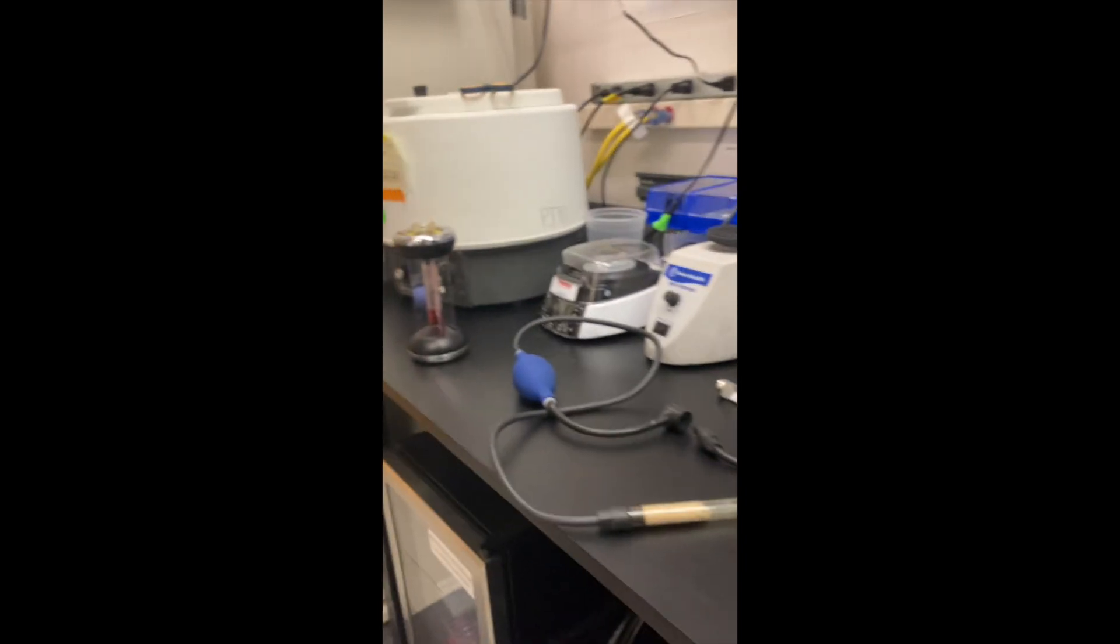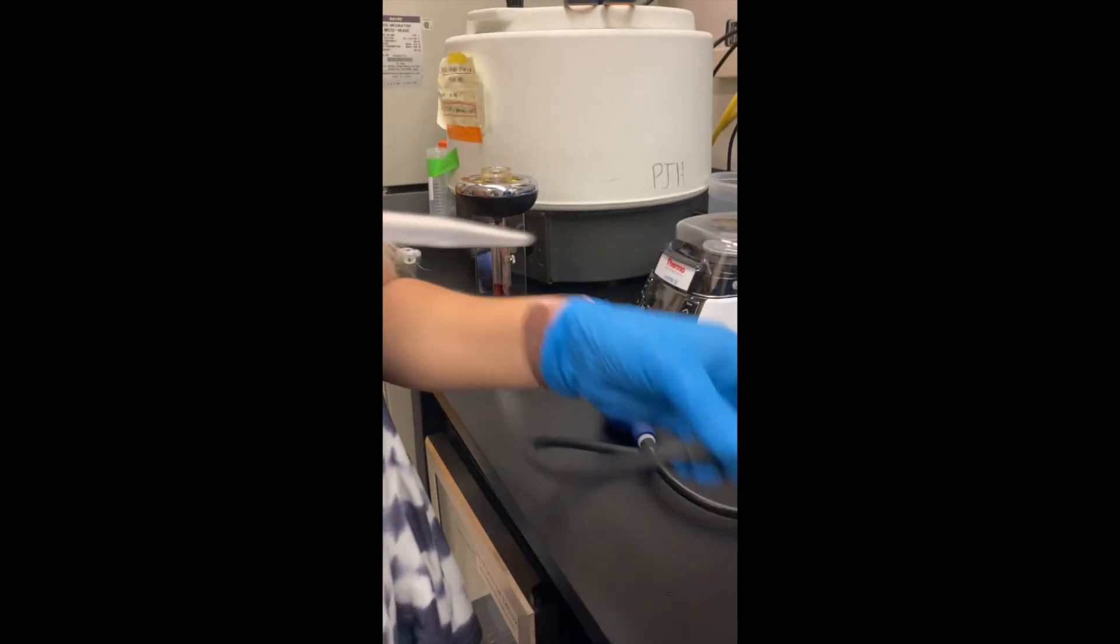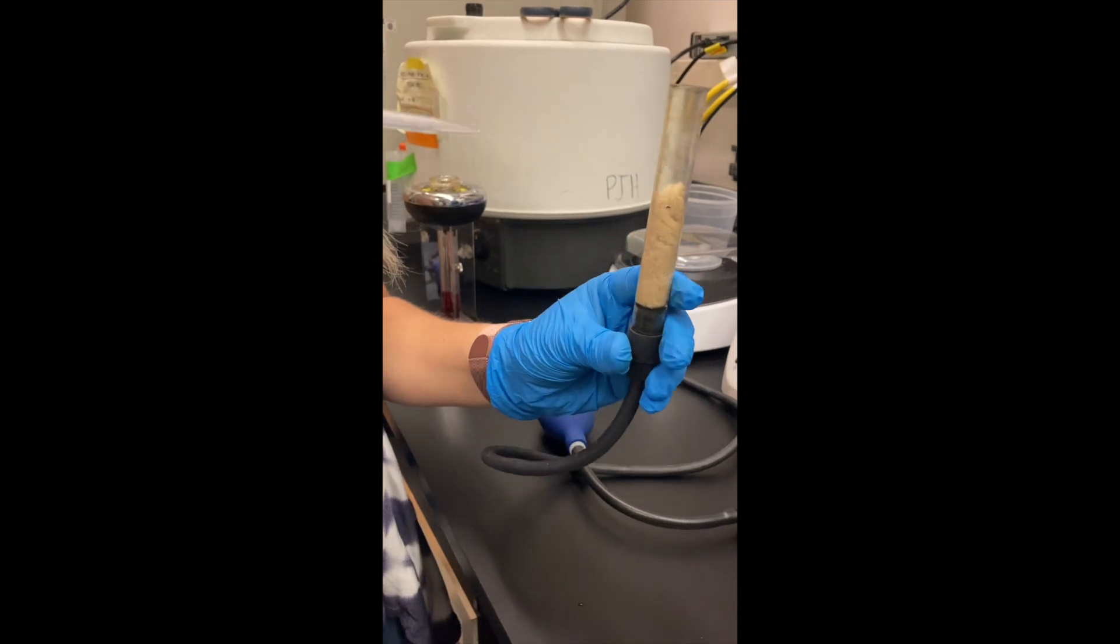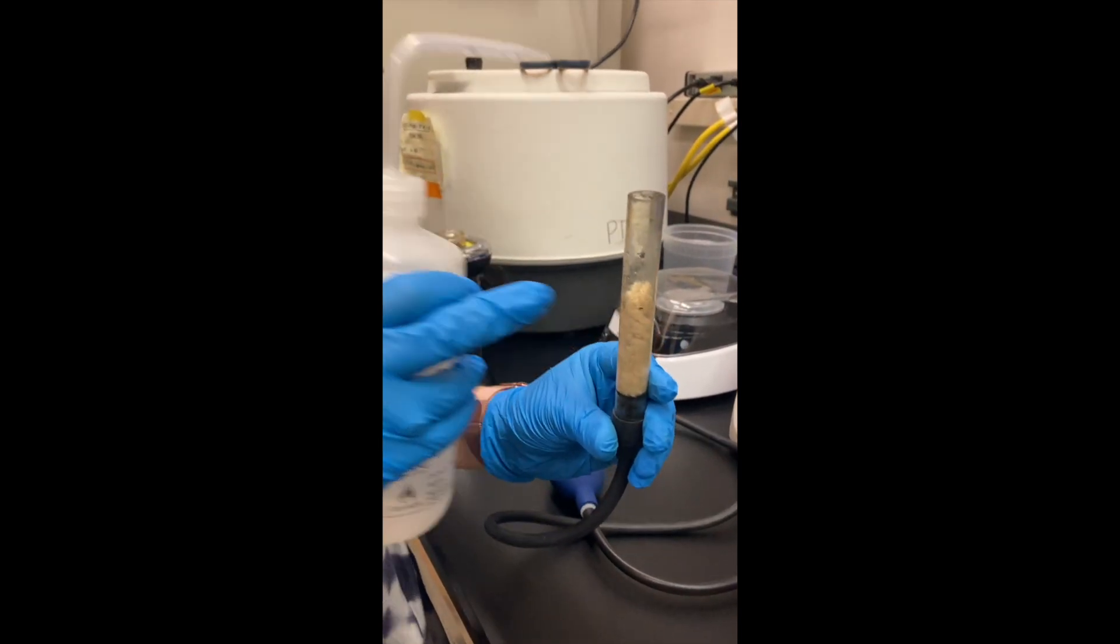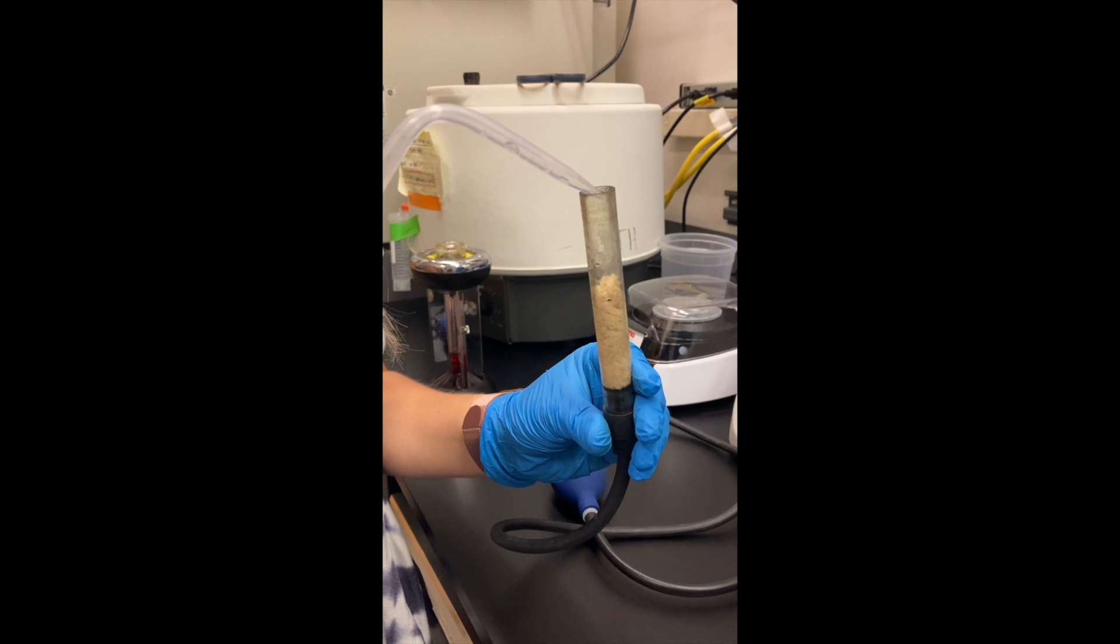And then we have double distilled water. So you don't want it to fill this, you just want to make sure this is wet. So you just want to put enough water.